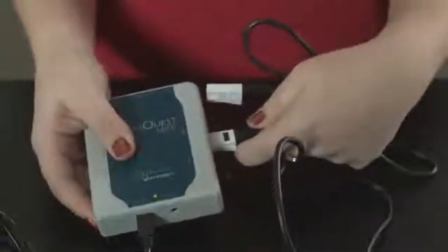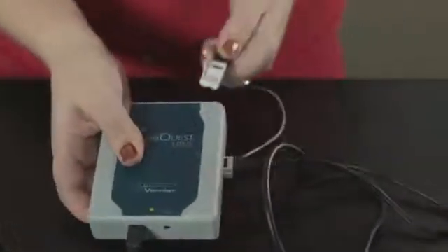First thing to note is that it has two cables coming out of it. One is analog and one is digital. They will only fit into specific ports on your interface. Today I'm using the LabQuest Mini with a computer and Logger Pro but you can also use it with LabQuest.